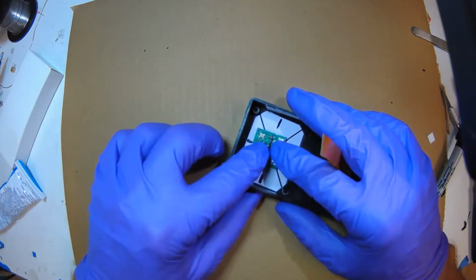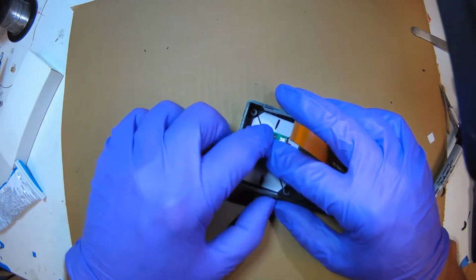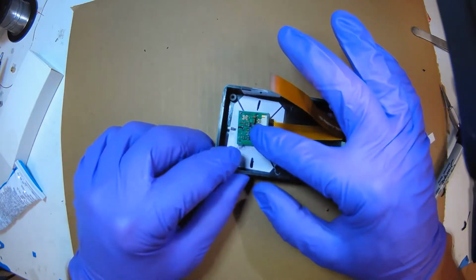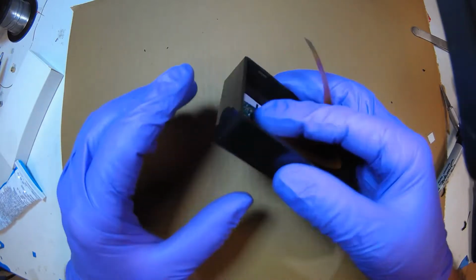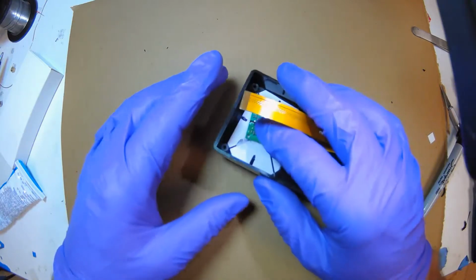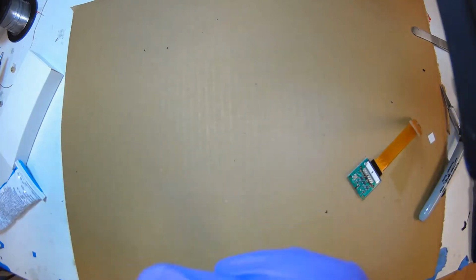I got my orientation lines, and just feel lightly. There's 2 points. If you put your finger in the center of that X, you should just lightly push it down, and you'll feel you're making intimate contact. I'm just going to turn it over, and you'll see that's what it's going to look like. Now mind you, this glass, this is your last chance, so look at the glass.